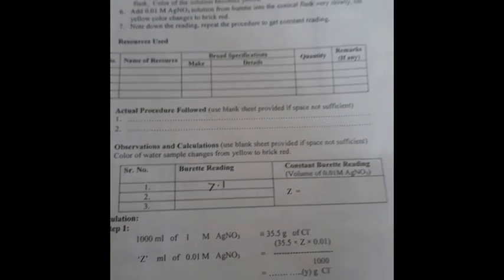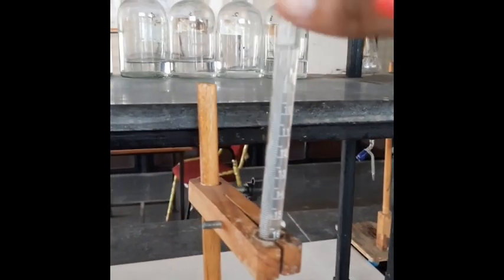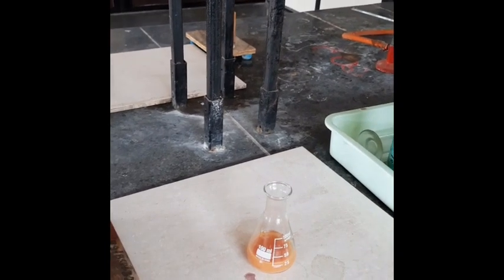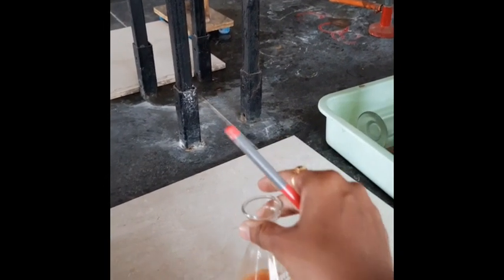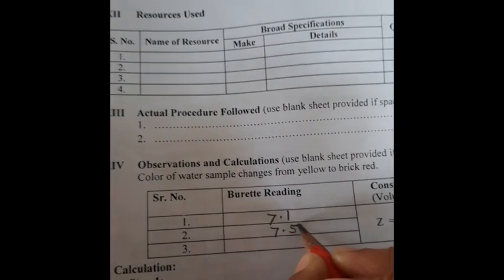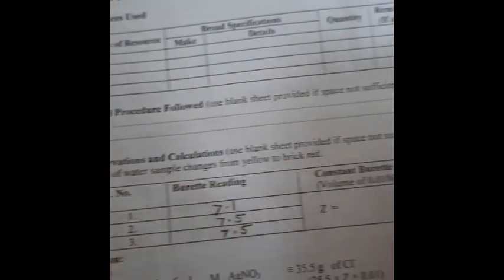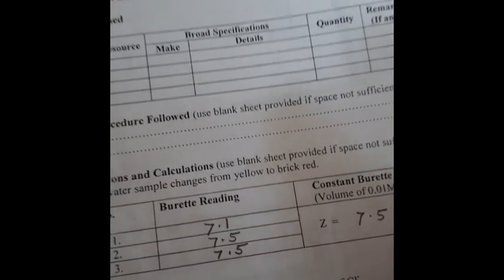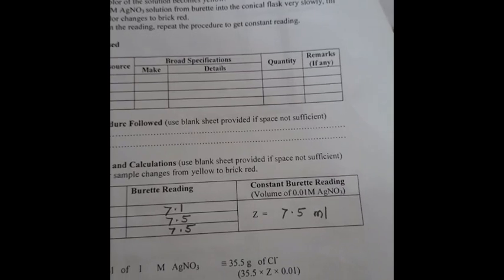Write this reading in the observation table. Our first reading is 7.1 ml. Similarly, we have to take two more readings. Again fill the burette with your silver nitrate solution, take 25 ml water sample in the conical flask, add 2 to 3 drops of potassium chromate indicator, and titrate with silver nitrate until color changes to brick red. Second reading is 7.5 ml and third reading is also 7.5 ml. The concordant burette reading — two constant readings — Z equals 7.5 ml.